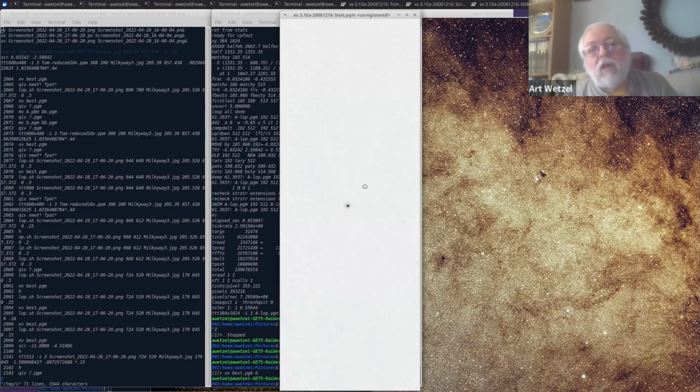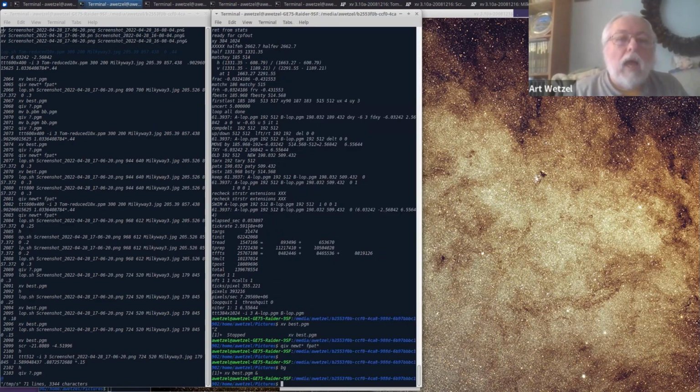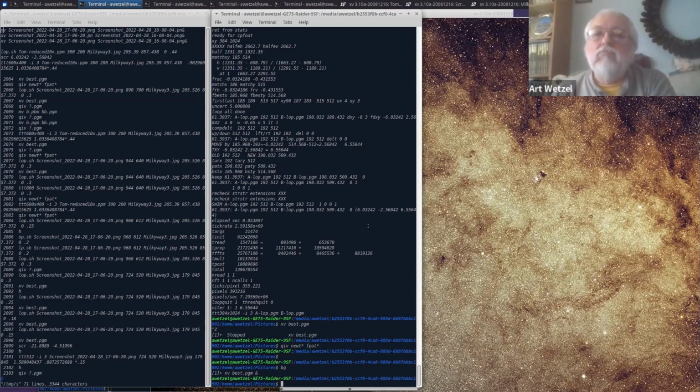I put my crosshairs there, and you see that that spot is slightly offset from the actual middle here. And that offset is communicated back to us and eventually to the user interface. So Tom will be interested in these numbers that we already use in the conventional image matching that give us XY offsets. But here the XY offsets are reinterpreted as scale and rotation.